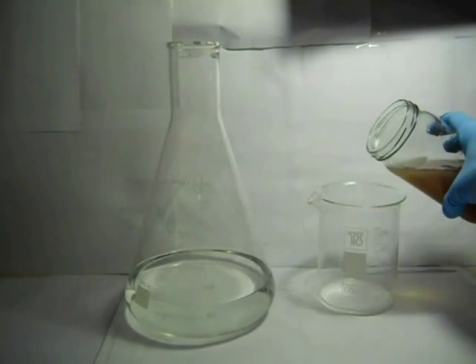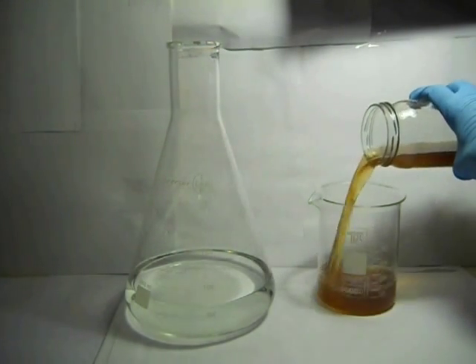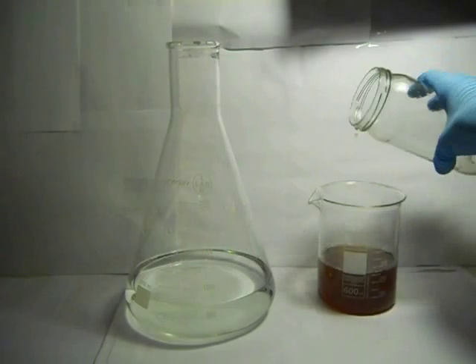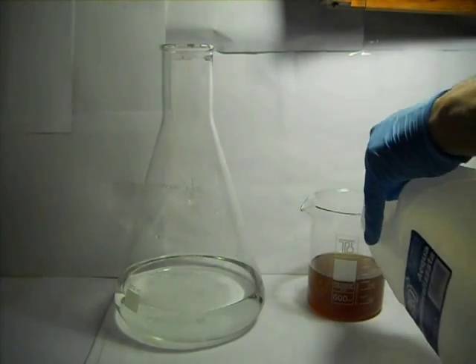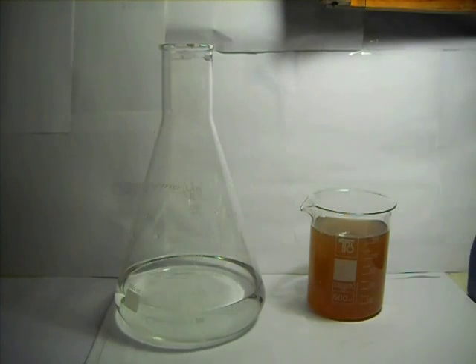Once the filtration of the solution containing hydrochloric acid and bones is done, with pH paper control the pH and dilute with water the orange-brown solution to a slightly acidic pH, about 4 or 5.